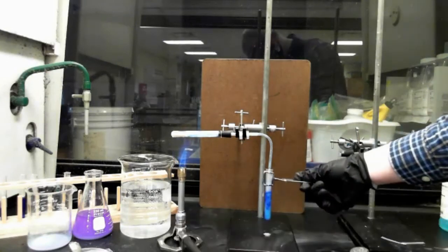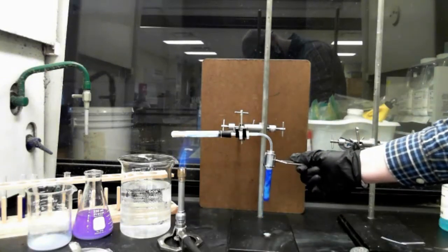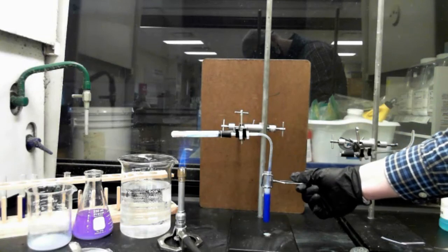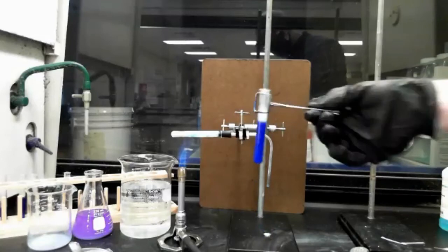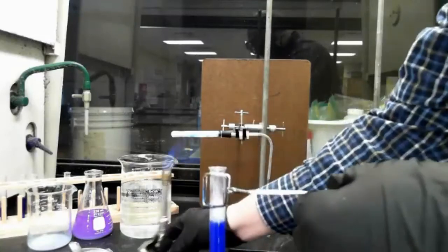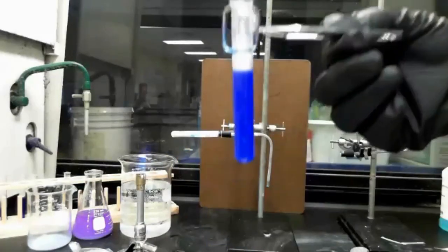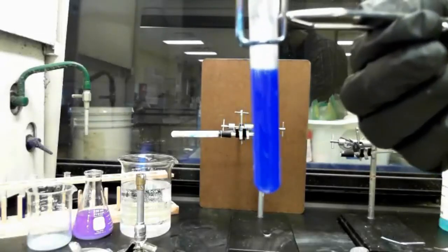So what we see now, this is the dark blue solution. There we go. As it blows out in there. So we finally got our reaction going.